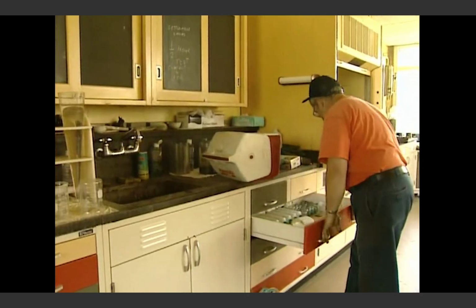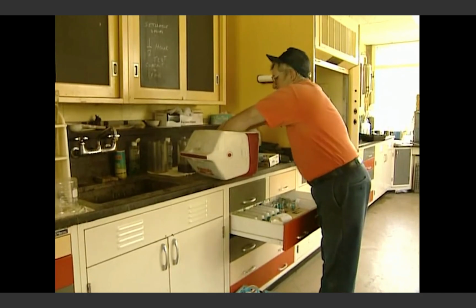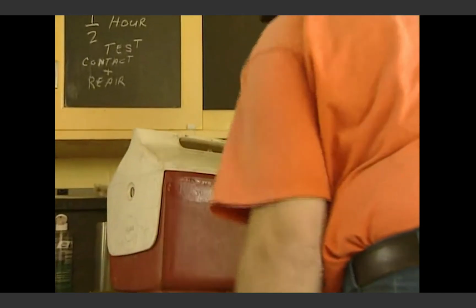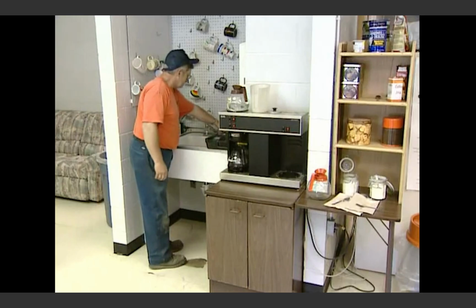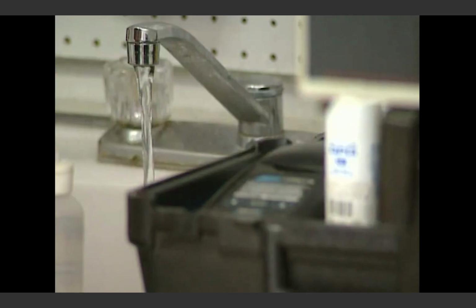The utility and local health officials examined the system operation, including the sample procedures and locations, and found problems. Poor sampling techniques, coupled with improperly maintained sampling sites, were cited as contributing factors to the problem. The water may not be bad, but the instrument it comes out of could be dirty, and it'll give you a positive reading in a heartbeat. It leads to a lack of confidence in your system and in your operators.